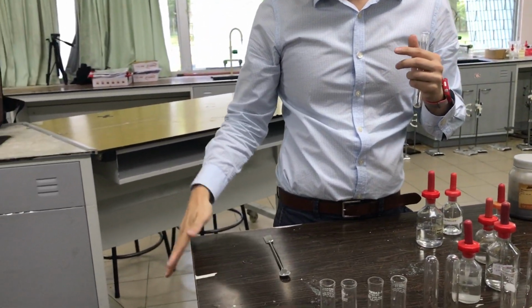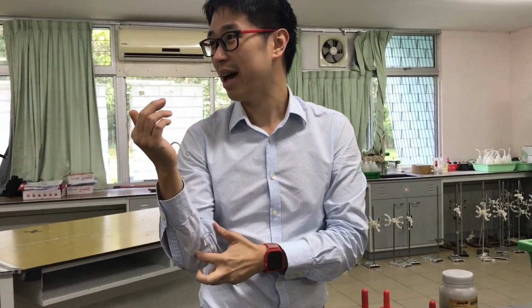But remember the test yesterday was, you need to use a moist red litmus paper, and then what happened to it? The red litmus paper turns blue, the gas is NH3 or ammonia. Okay, you remember the smell, right? You don't need to smell it again, right? Everyone remember it? Now remember the observation as well, yeah?